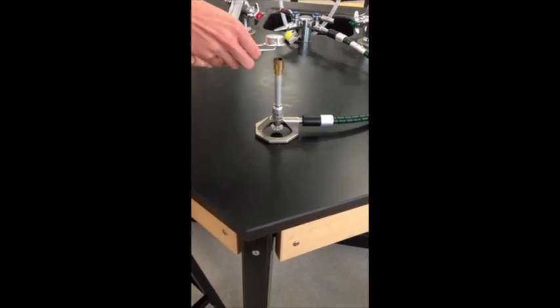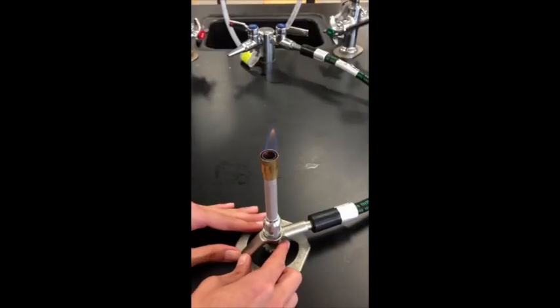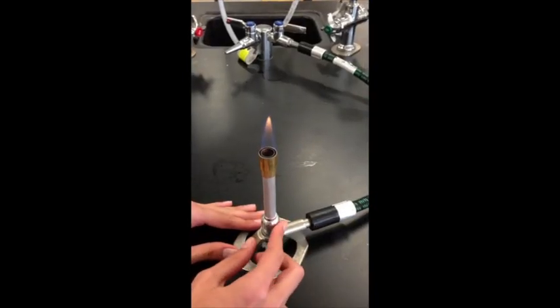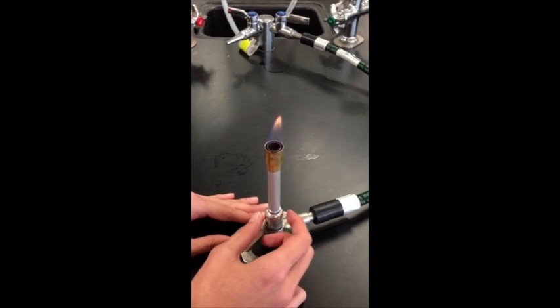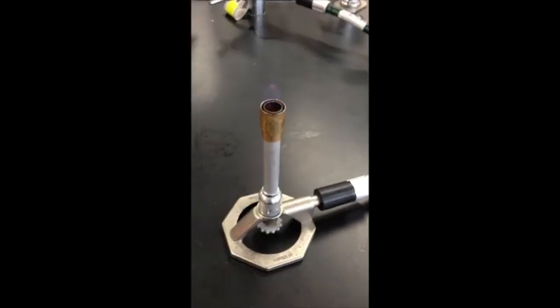In this lab, you'll use a Bunsen burner, and you'll need to learn how to find the perfect flame. You need a single blue flame.